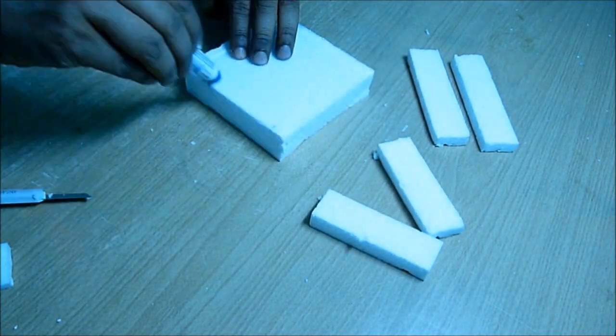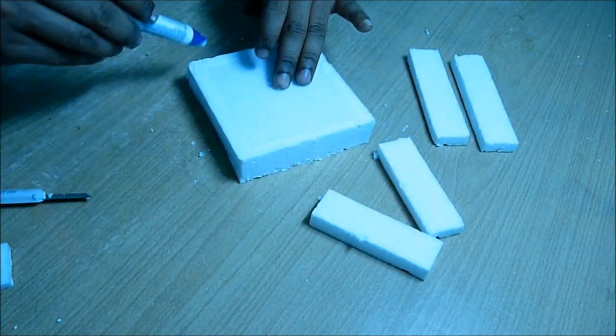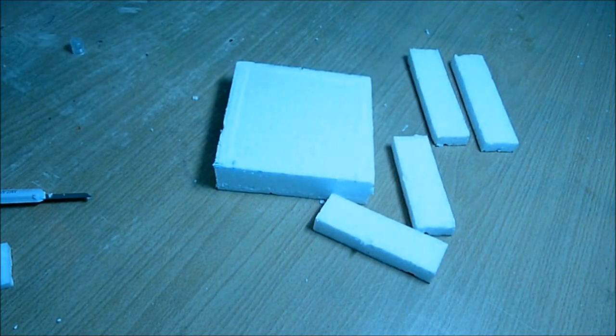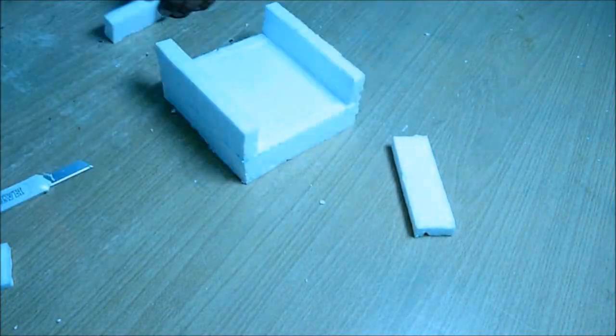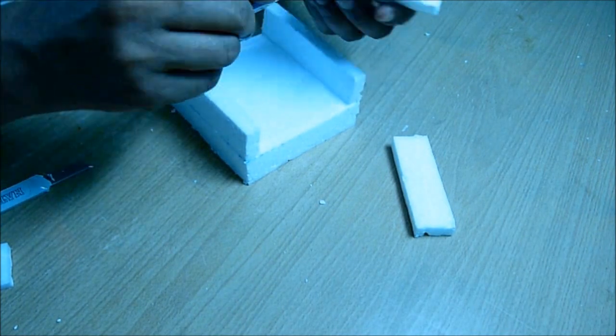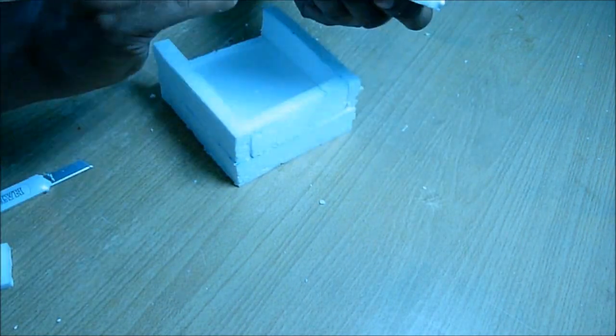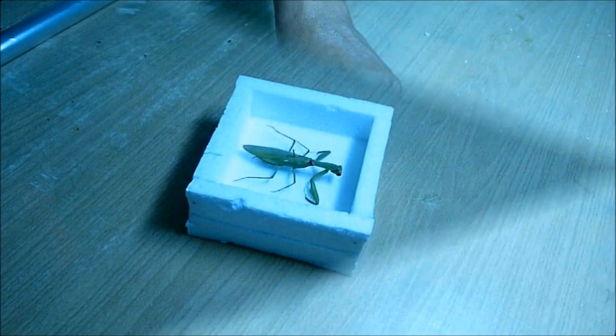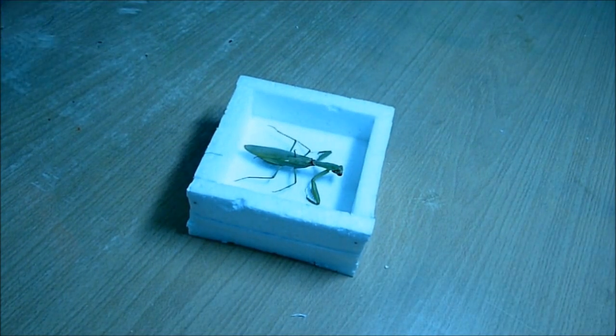Very simple, made for wall. I just glued it on top of the base, then placed the insect inside.